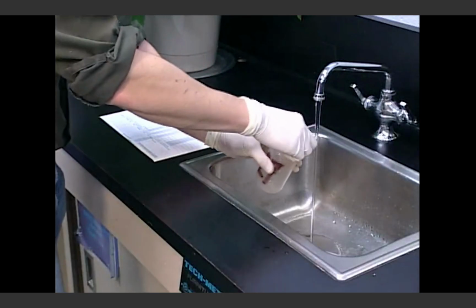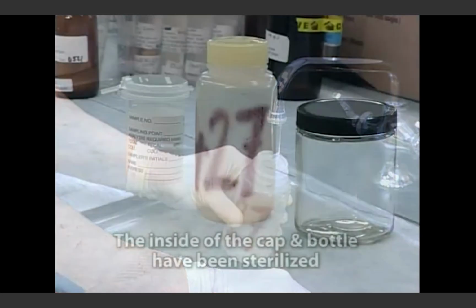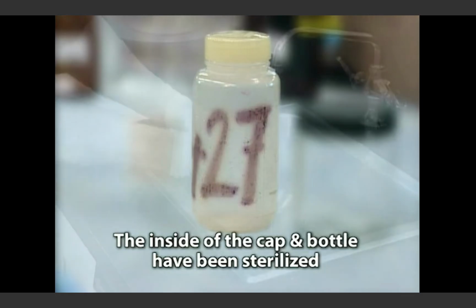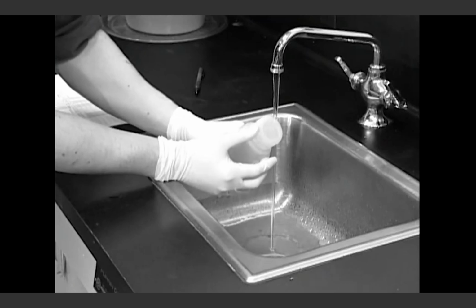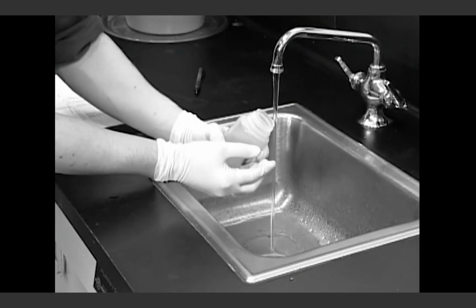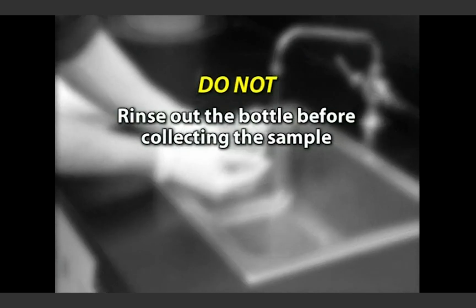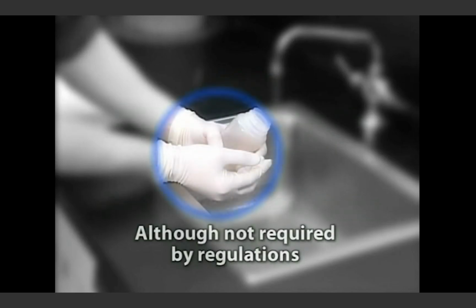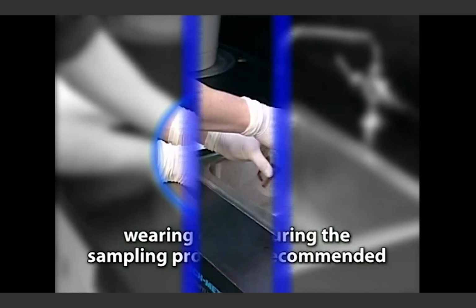When the bottle lid is removed, hold its threads down and do not touch the inside of the cap. Remember that the inside of the cap and bottle have been sterilized. Do not set the cap down or place it in a pocket. If the bottle lid becomes contaminated, it may contaminate the sample. Do not rinse out the bottle before collecting the sample, and do not touch any portion of the inside of the bottle. Although not required by regulations, wearing gloves during the sampling process is recommended.